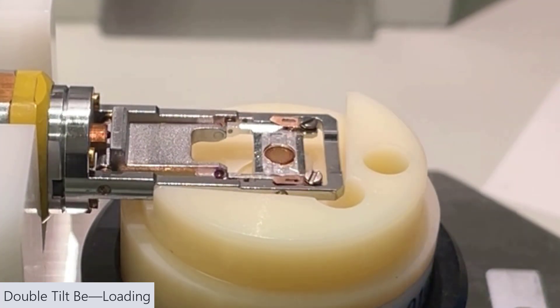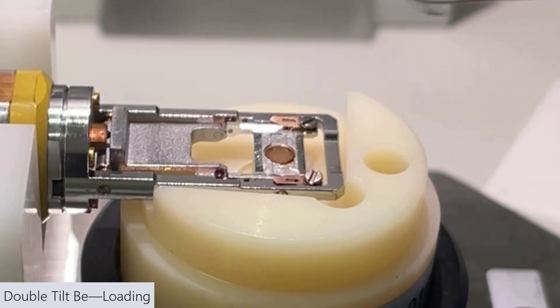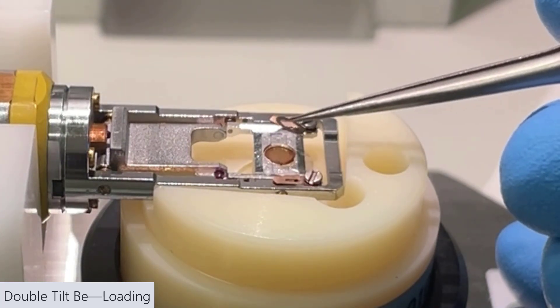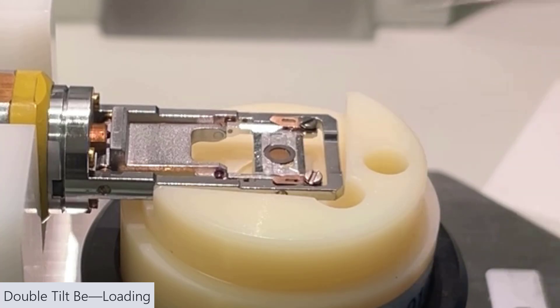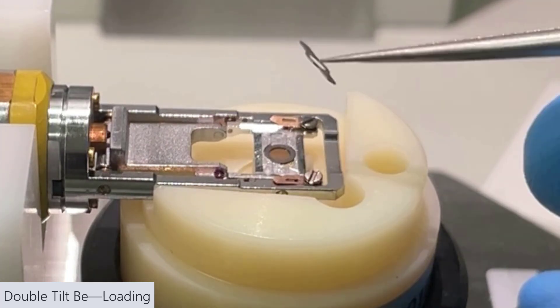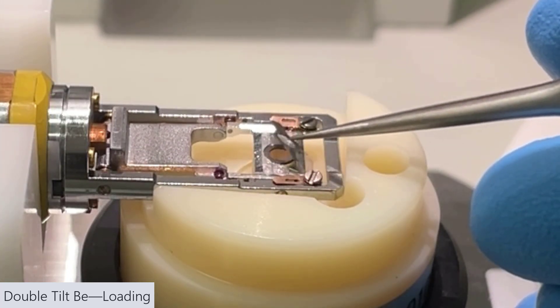Make sure it's seated properly. You can see it's not, so I'm just nudging it. Now we have a beryllium spacer that we're going to put down first. Make it seat properly and then the beryllium cap.